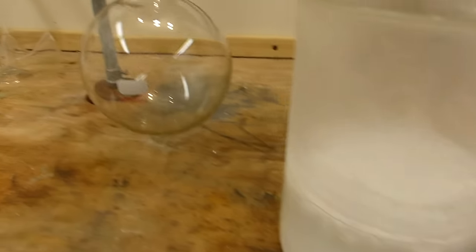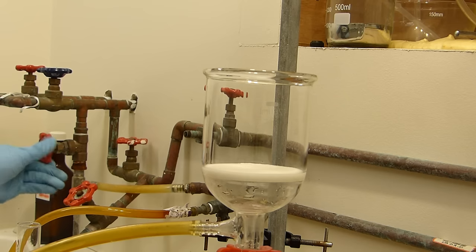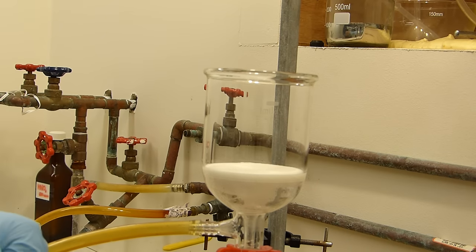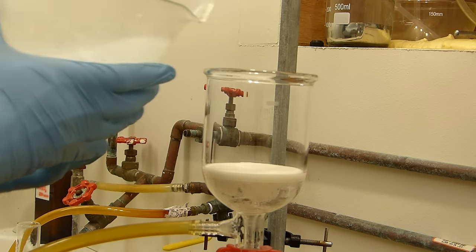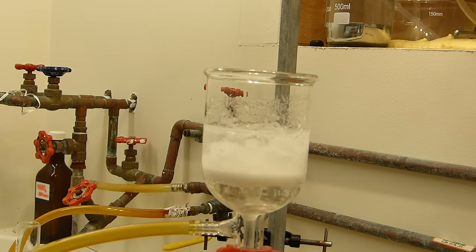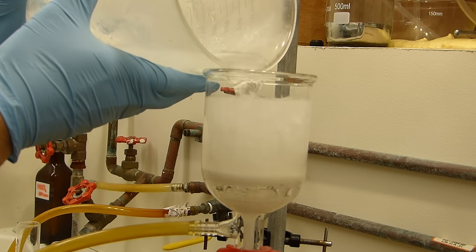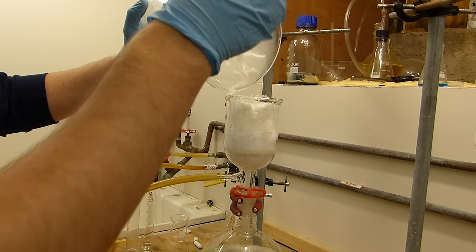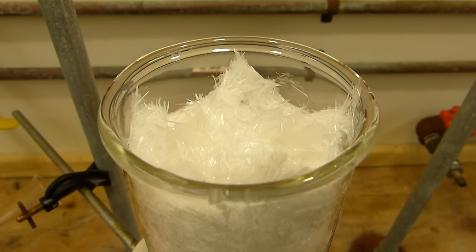vacuum filtration and go ahead and run this through. Since I have over a liter of material here, I'm probably going to have to fill up this flask and empty it out a few times, but no big deal. Let's get to it.